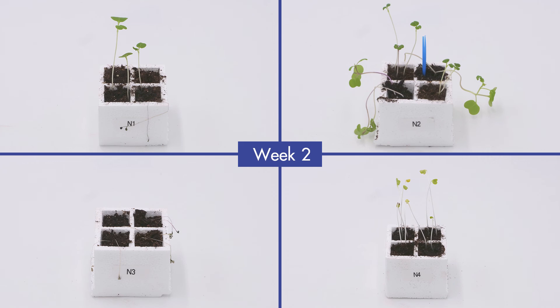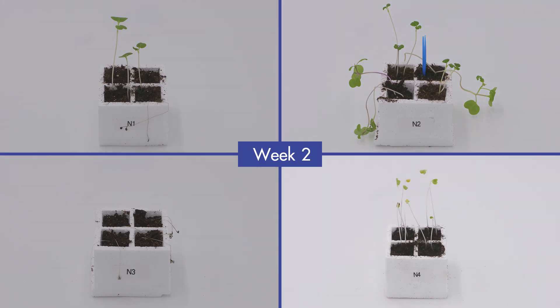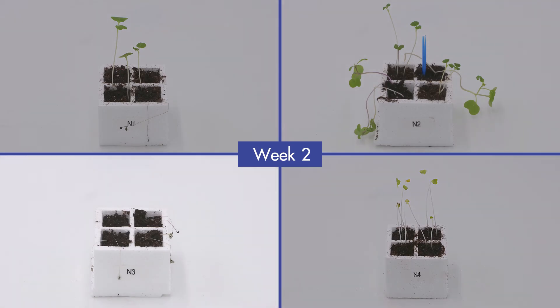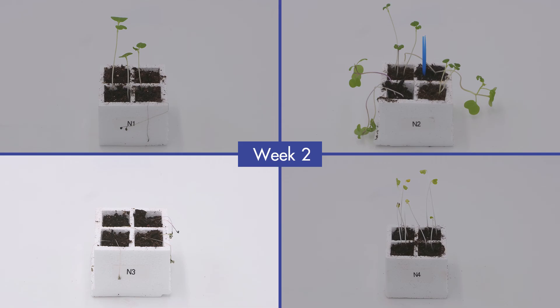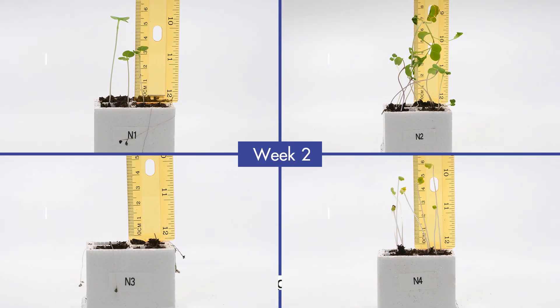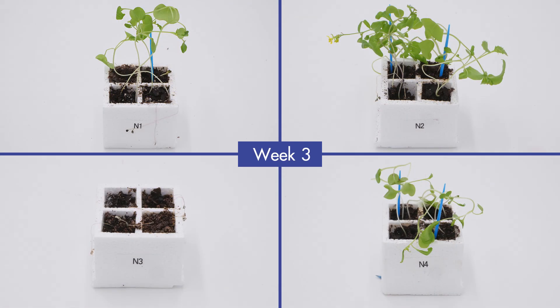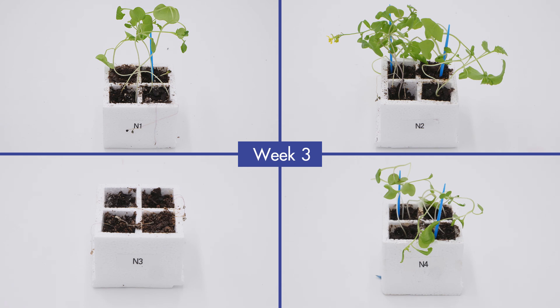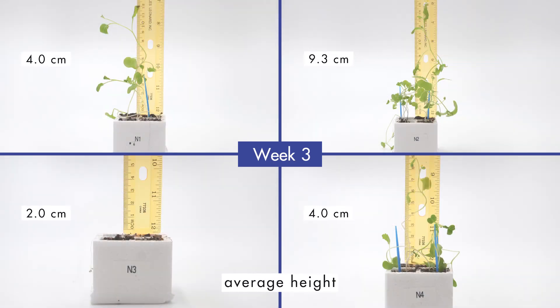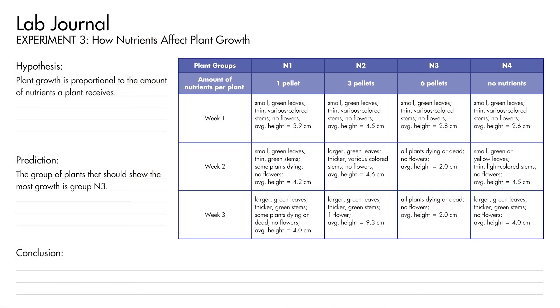Observe the four groups of plants at the end of week two. The plants in group N2 are the healthiest and tallest. The plants in group N4, which received no additional nutrients, are not looking healthy. Even though the plants in group N3 received more fertilizer than any other group, they appear to be dying. Record your observations and the average height for each group in your journal. Now observe the four groups at the end of week three and record your observations and average heights.